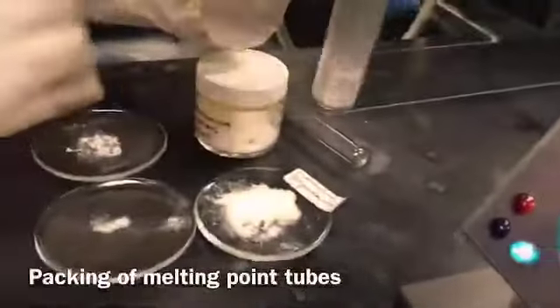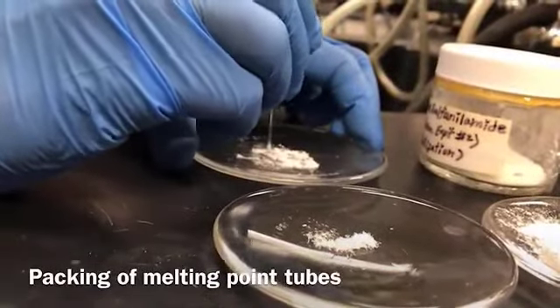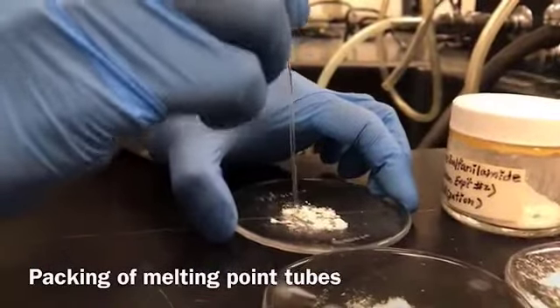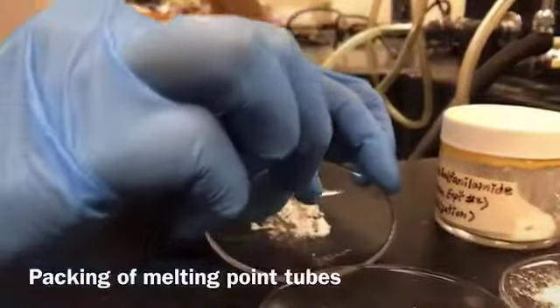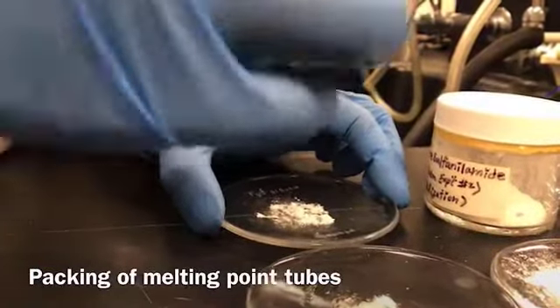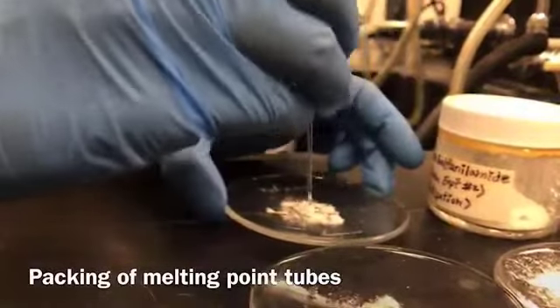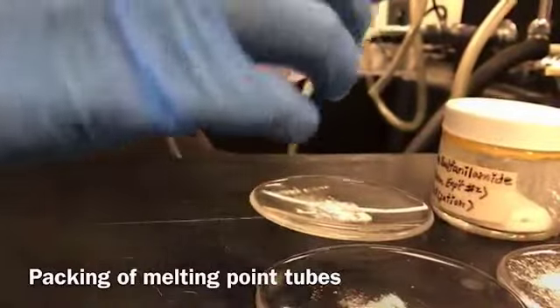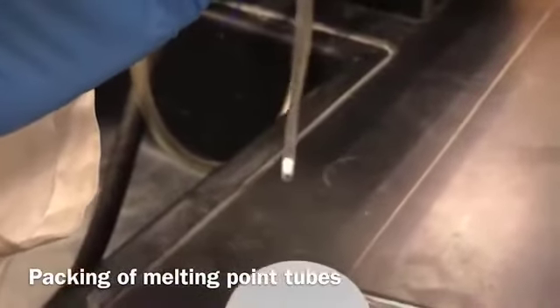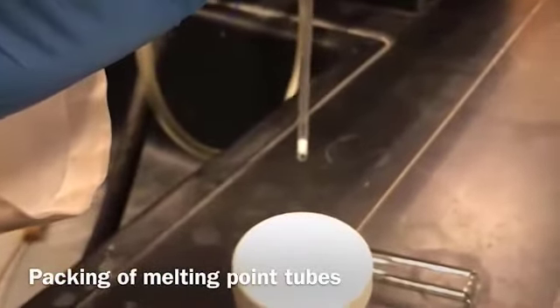And pick the capillary tube. Now I'm going to tap it in a tapping tube, and make sure of the height of the sample in the capillary tube after tapping through the tapping tube, which I'm going to show you in a little bit.